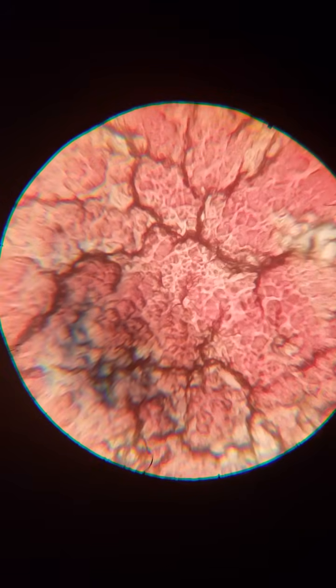It's really hard to get them to focus unless you have a slide cover on there. But you see the little round deals? Everything you're looking at here is stacks, like 30, 40, 50 tall, of the little round guys that have clumped together because they're out of the body, and that's what they do with the hemoglobin. And the white blood cells have gone to the outside, sacrificing themselves.